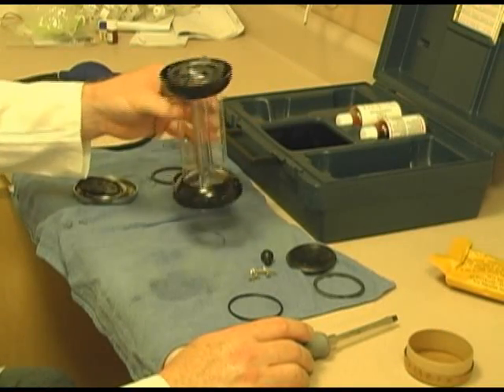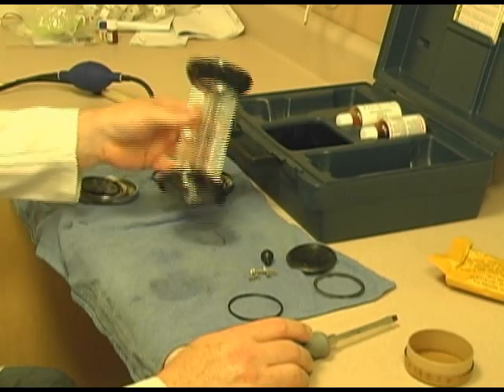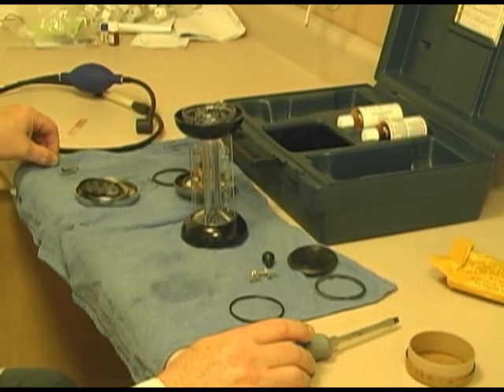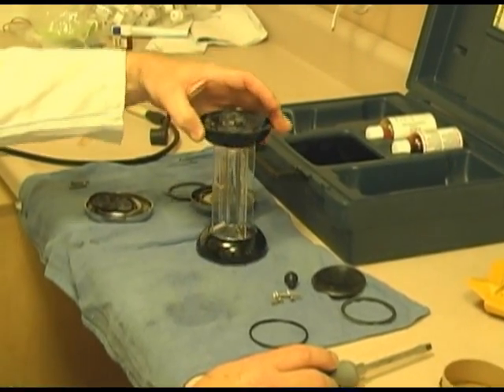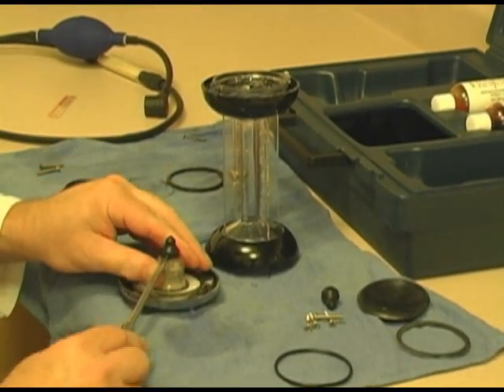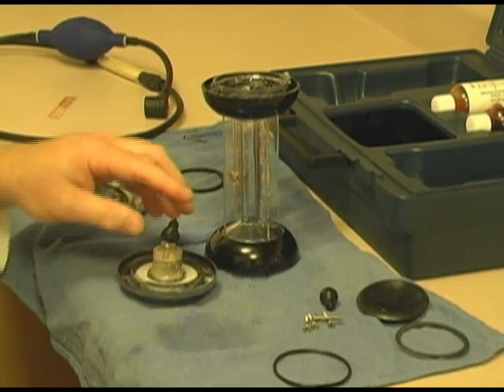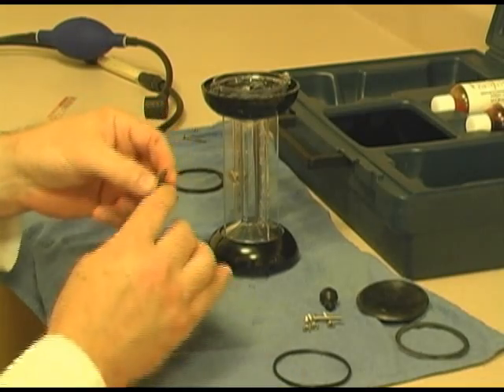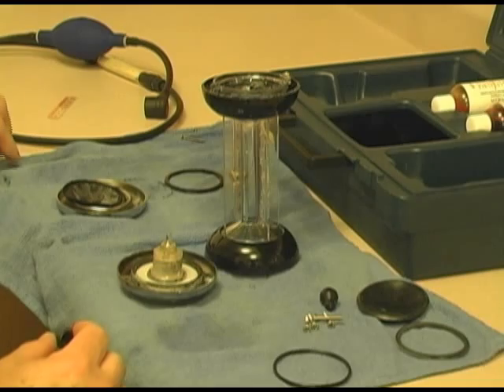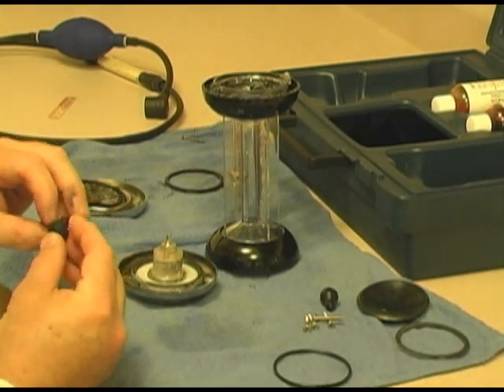I simply wash this out with warm soapy water. Usually rinse it with distilled or something, just to be cautious. There's nothing to it. I just cleaned it up. We're going to start with the top. This rubber gasket needs to be replaced. And it's not really hard to come off. I don't even know that I need to use a screwdriver. It pops right off. You see how this black stuff gets on your fingers. And that's why I say it's when you're storing it upside down. And that's what I think happens. Eventually you'll find little pieces of it all over the place.